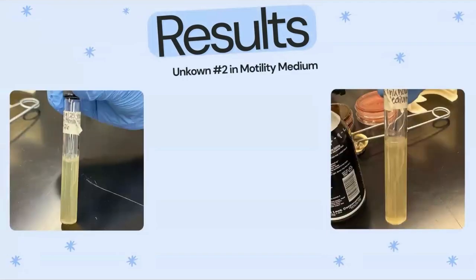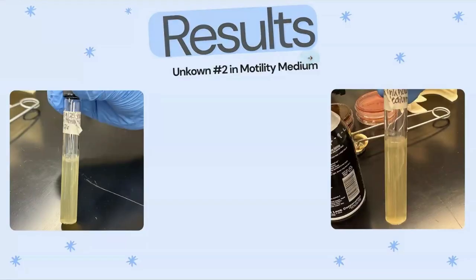For the unknown number 2, this is the type of growth in this motility medium that is probably the least visible. We do see that there is a type of film at the top of the liquid where the motility medium starts. This does indicate growth, and with the different lighting, you can see that on the left side, you see the linear growth, and on the right side, you can see more precisely exactly how it grew. And this was the unknown number 2.